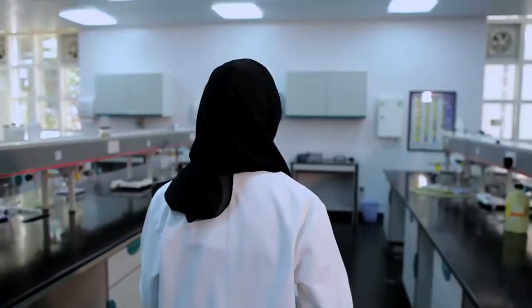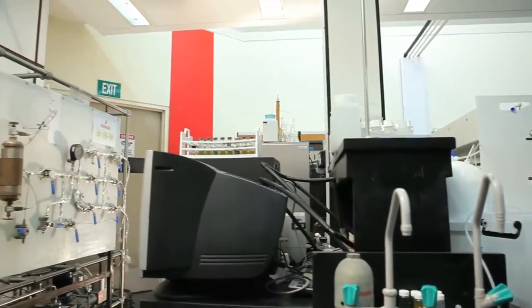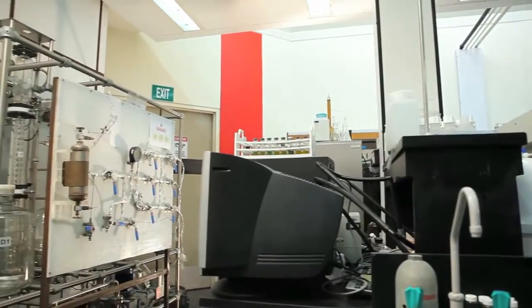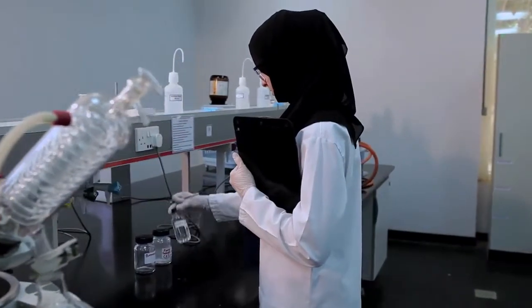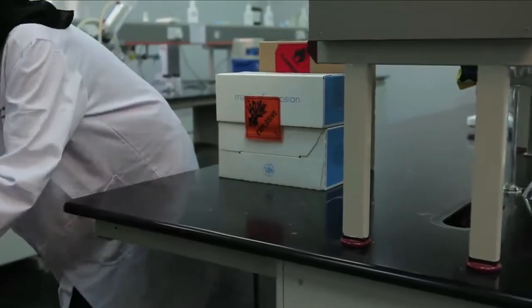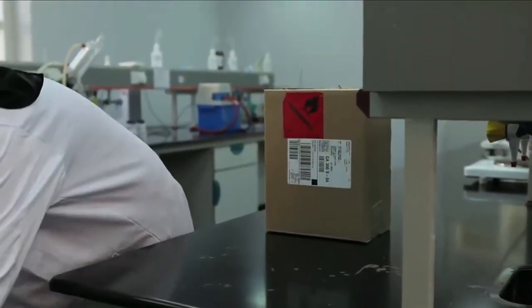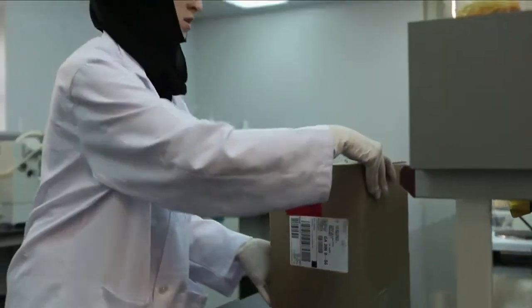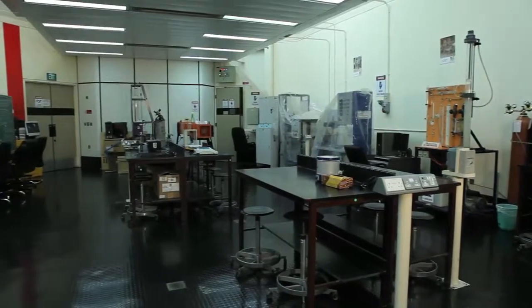Next, conduct a thorough evaluation of your entire lab, including your housekeeping and storage practices. Begin at the main entrance and take a careful look around. Good housekeeping helps eliminate fire hazards and maintains access to emergency equipment. Be sure all laboratory spaces are clear of all unused boxes, paper and other combustible materials, as these items increase the potential for fire in the work area.